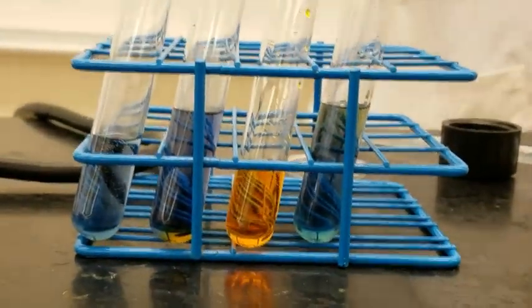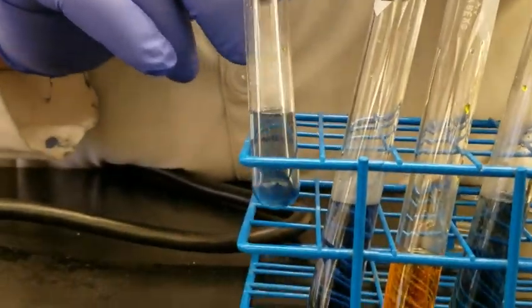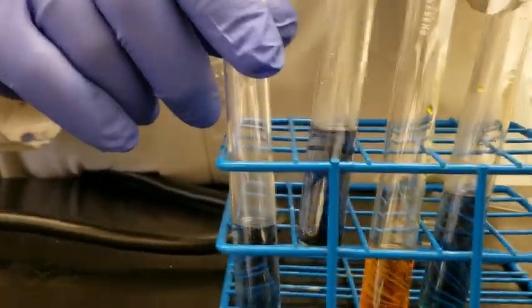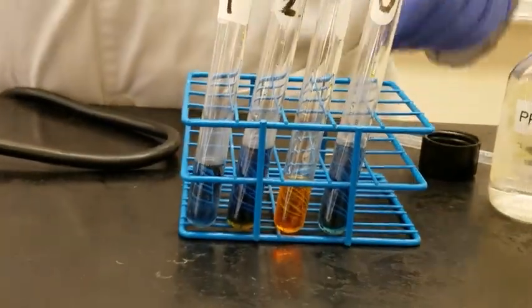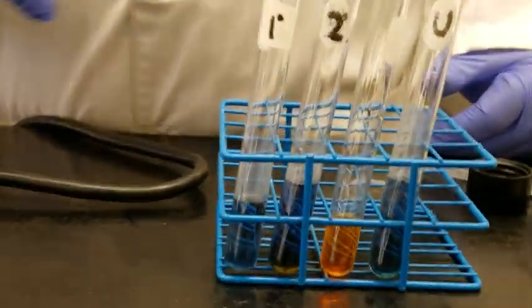Are we in agreement? Now, for those people who are more advanced in chemistry, usually the primary one gives more of a bluish color. The second one gives more of a greenish color. So this one, I am tempted to think that it probably is a primary alcohol. But again, you can't decide for sure that it's primary, secondary, or tertiary alcohol. Did I mess you up? So far, so good? Any questions, please?